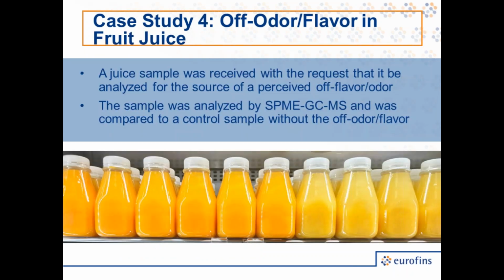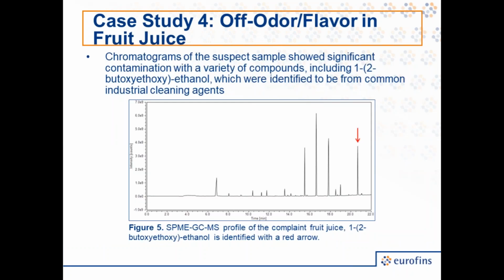In a related case study, we also looked at an off odor and off flavor in a fruit juice. In this case, the fruit juice had an off flavor and was caught prior to being shipped to customers. And so we analyzed these juices with the off flavor alongside control samples. And what we found is that chromatograms of the suspect samples showed significant contamination with a variety of compounds.